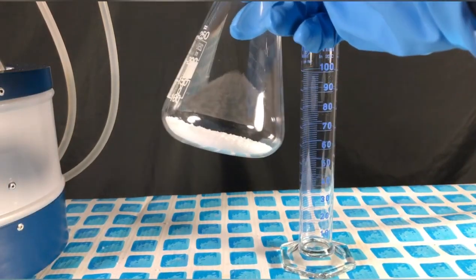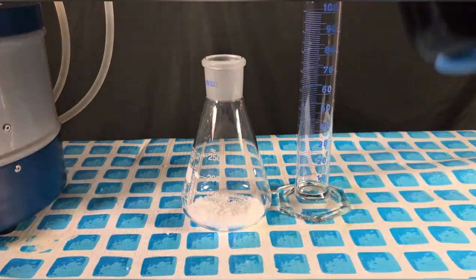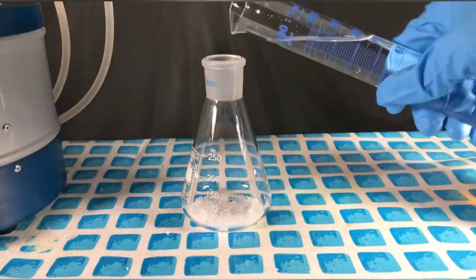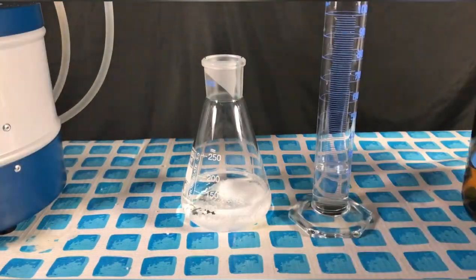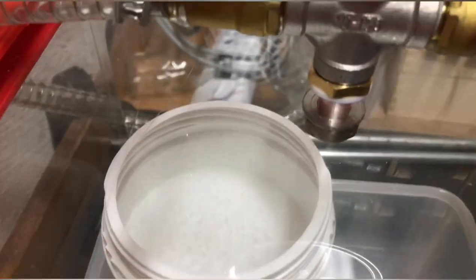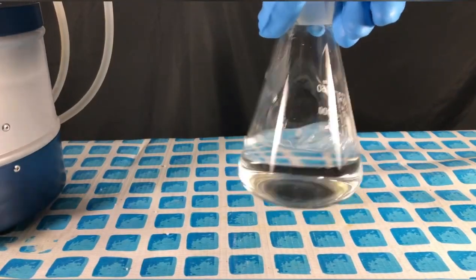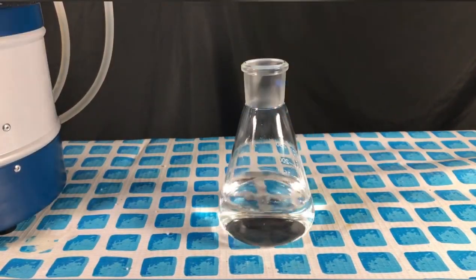15 grams of urea were weighed out and dissolved in 120 ml of ethanol. By the way, I dried the urea over anhydrous calcium chloride in a vacuum desiccator overnight. The urea-ethanol mixture was left on a hot plate until all of the urea had dissolved.